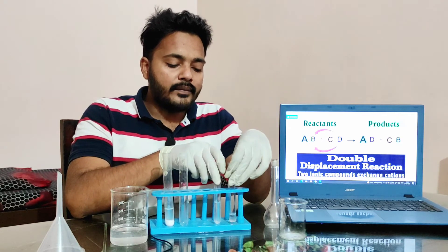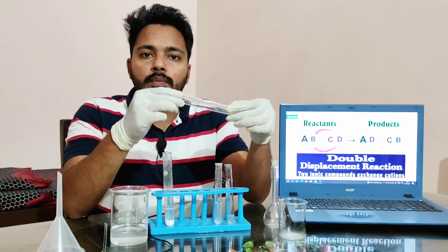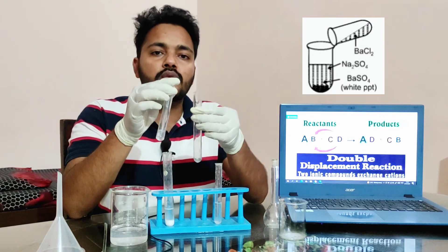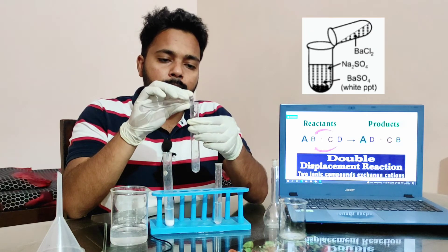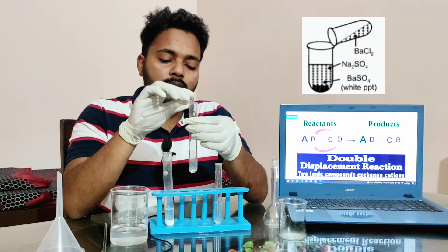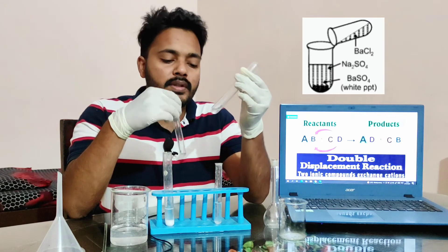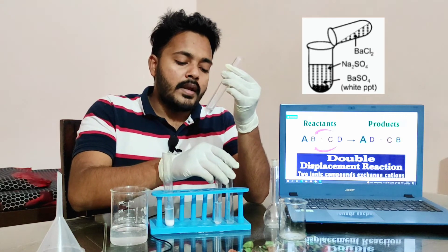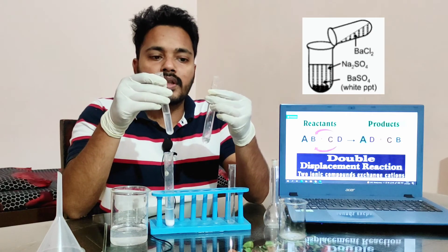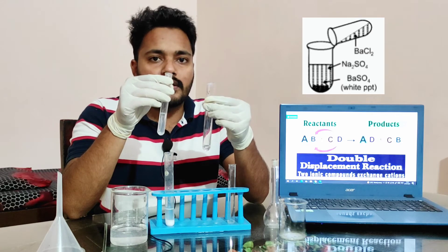The second step is to take a clear boiling tube. Add a few amounts of barium chloride solution into it. I have added the barium chloride solution. Now it is time to pour some amount of sodium sulfate solution into it. Please observe — double displacement reaction is a very fast reaction.